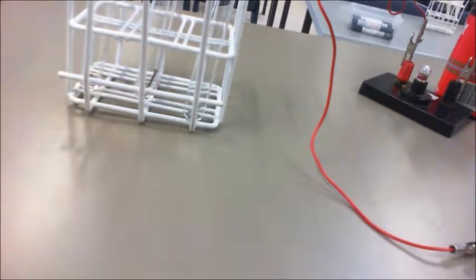There's a couple of bubbles that sit around the actual iron there. So then our third metal is our magnesium. So we'll see what we can get going on with our magnesium, and as you can see there, and even here, it's vigorously bubbling, so there's a fair amount of gas being produced, and that gas that is being produced is in fact hydrogen gas.